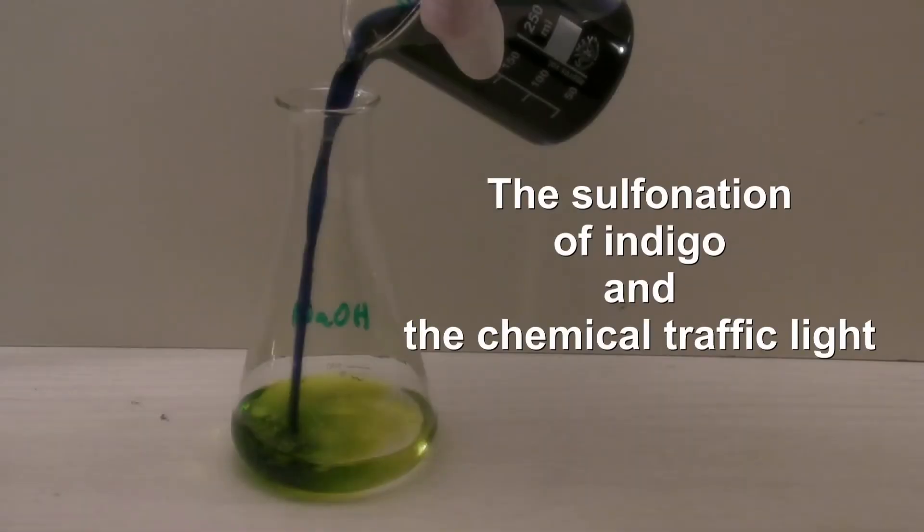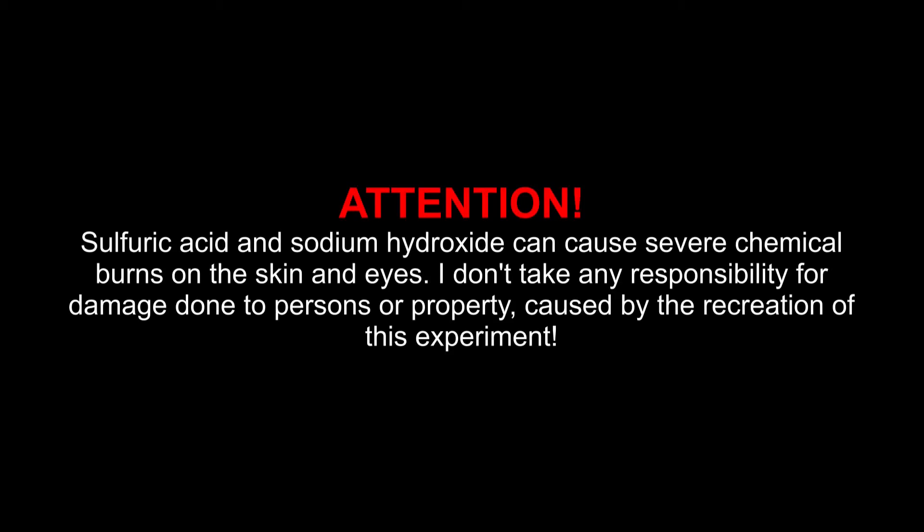The sulfonation of indigo and the chemical traffic light. Attention! Sulfuric acid and sodium hydroxide can cause severe chemical burns on the skin and eyes. I don't take any responsibility for damage done to persons or property caused by the recreation of this experiment.